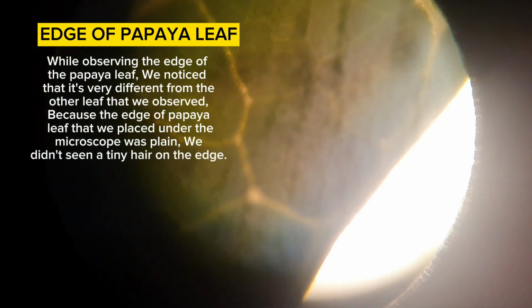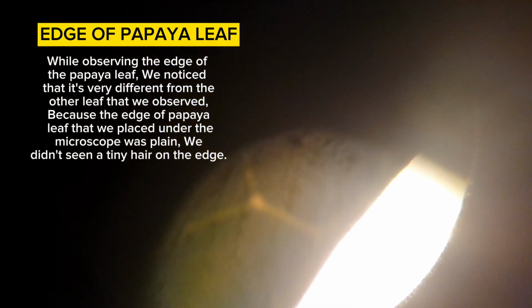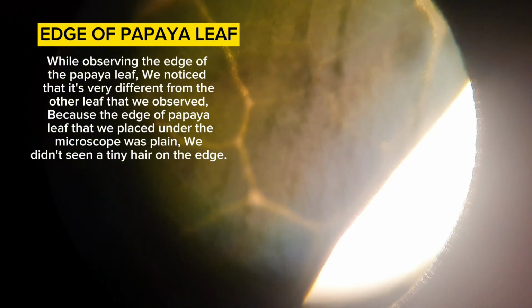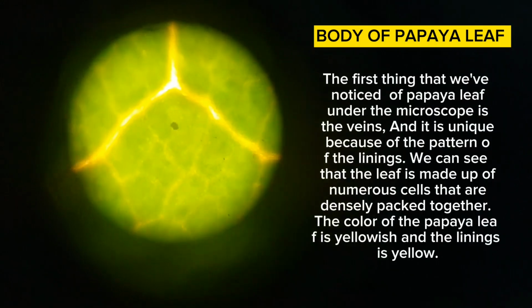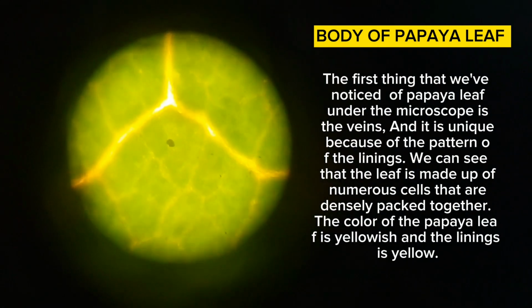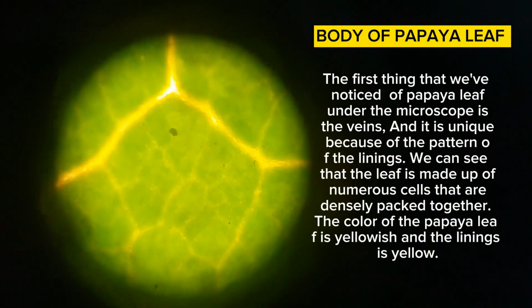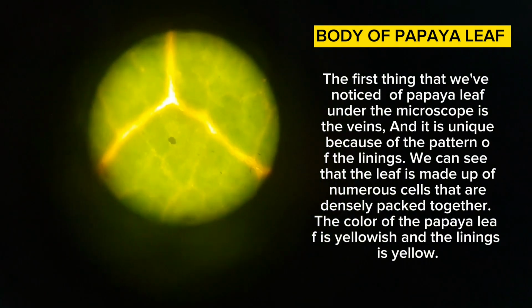While observing the edge of the papaya leaf, we noticed that it's very different from the other leaves that we observed. The edge of the papaya leaf that we placed under the microscope was plain; we didn't see any tiny hair on the edge. The first thing that we noticed under the microscope is the veins, and they're unique because of the pattern of the linings. We can see that the leaf is made up of numerous cells that are densely packed together. The color of the papaya leaf is yellowish and the lining is yellow.